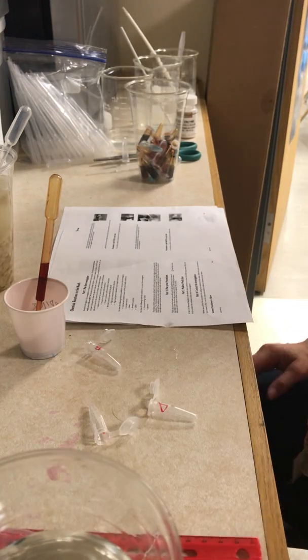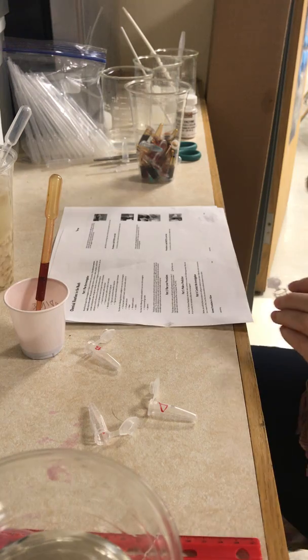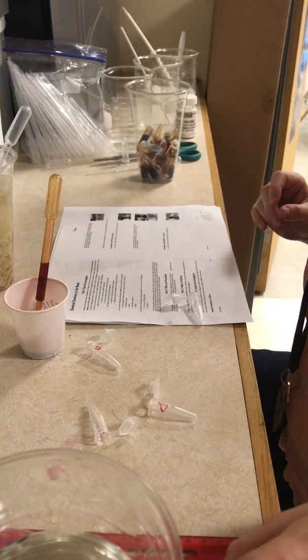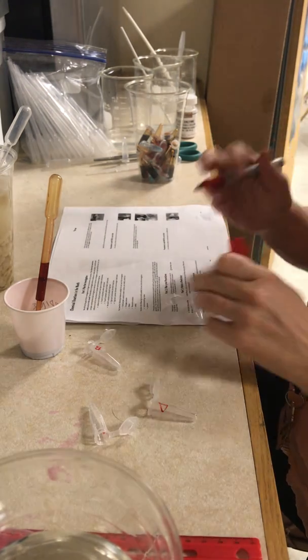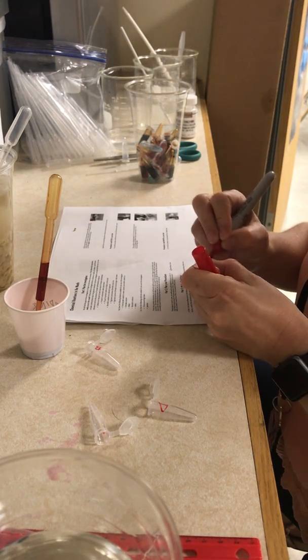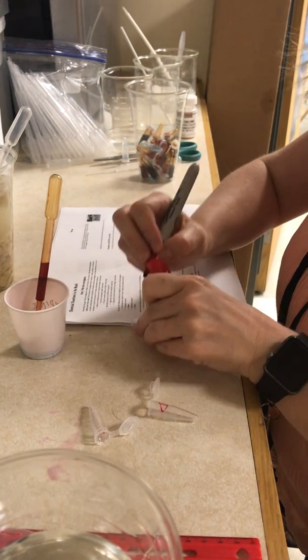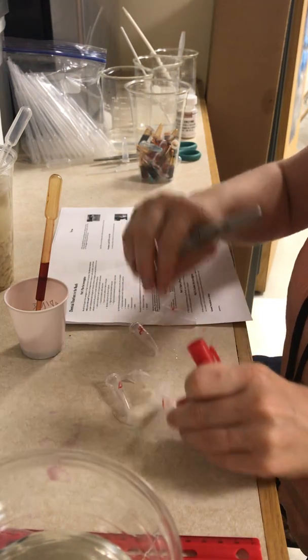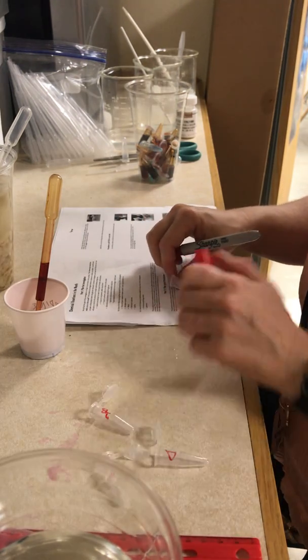Here I am in Lesson 5, Metabolic Reactions, Chemical Reactions in the Mouth. We're going to prepare four tubes for the investigation. I'm going to label my tubes A, B, C, and D, and put them all off to the side.